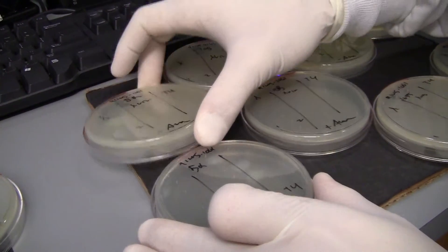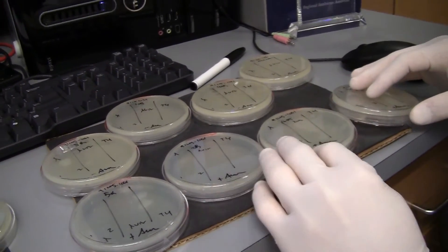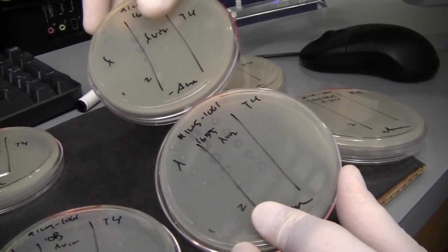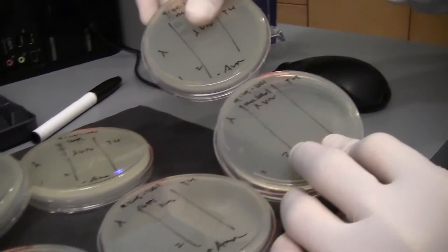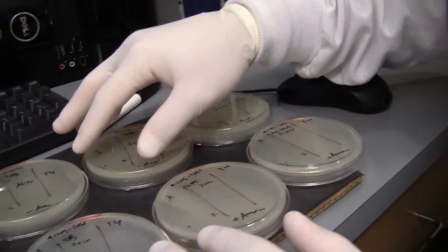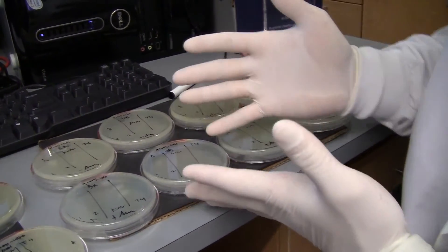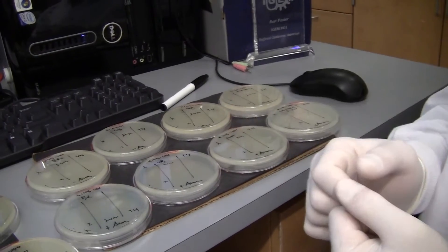If you look really closely you can see a little bit of clearing around the colonies, but that goes across the board — all of these plates I induced with P-Bad T4M are looking pretty sparse. You need to really pay attention to what the top agar looks like. If it did not grow up and you don't see plaques, it's not that your phage didn't work — it's just that there's no bacteria to lyse, so you don't see a phenotype.